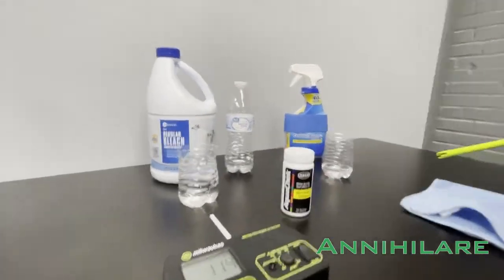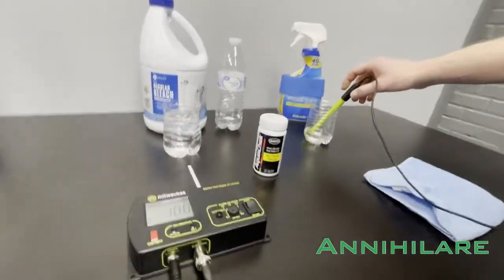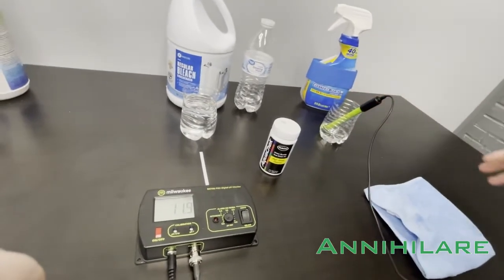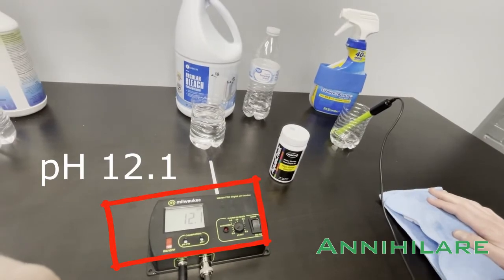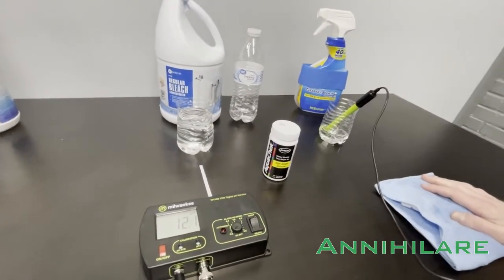So we're going to test the pH first. We're going to expect this to be high because there's a soap in it, there's a surfactant, so we kind of expected it to be higher than a neutral product.